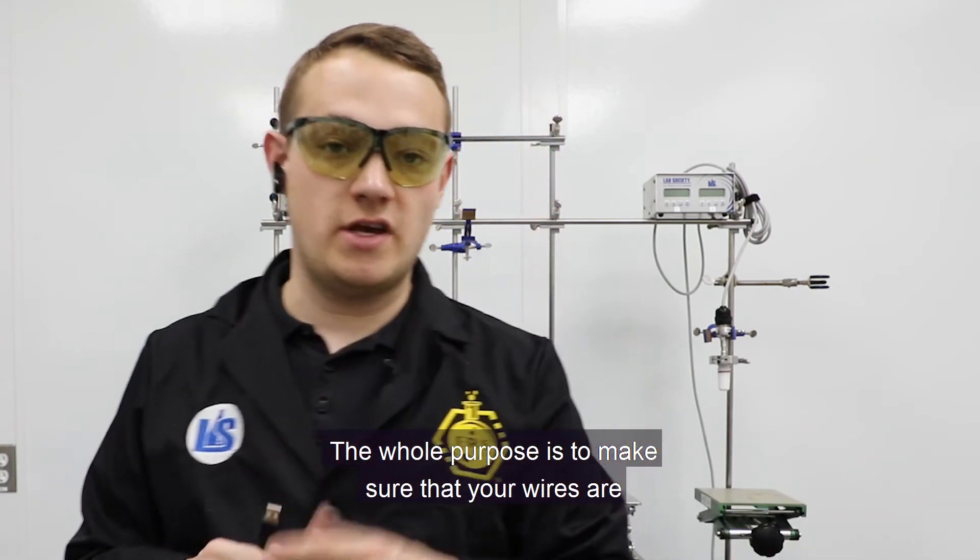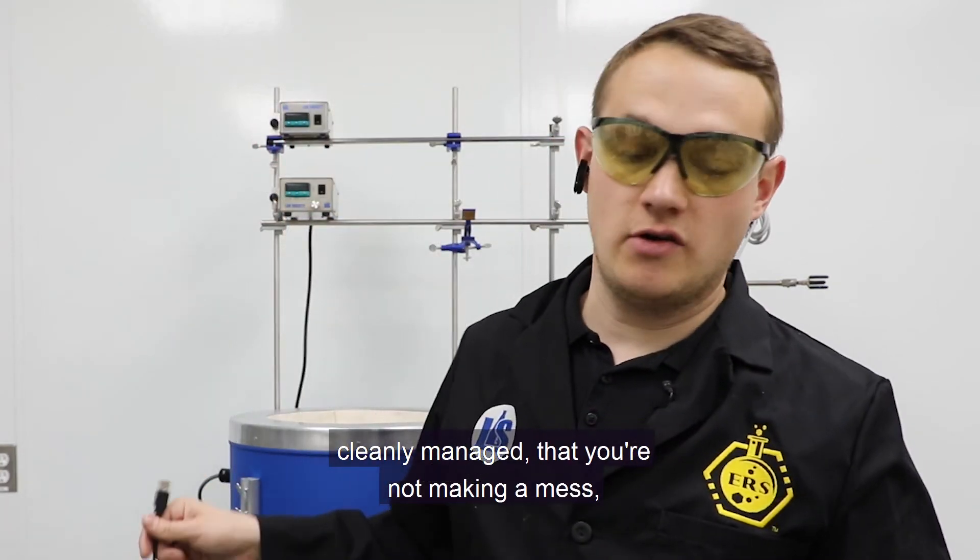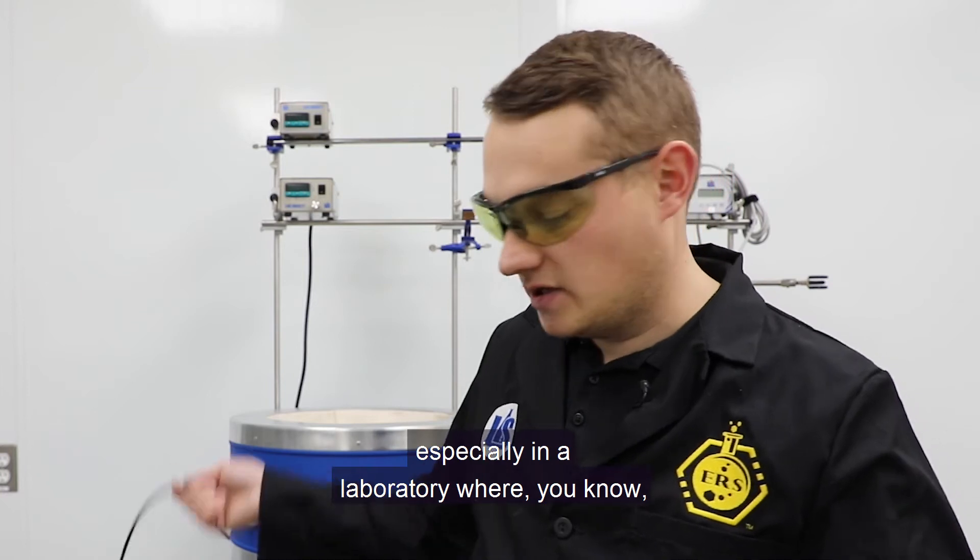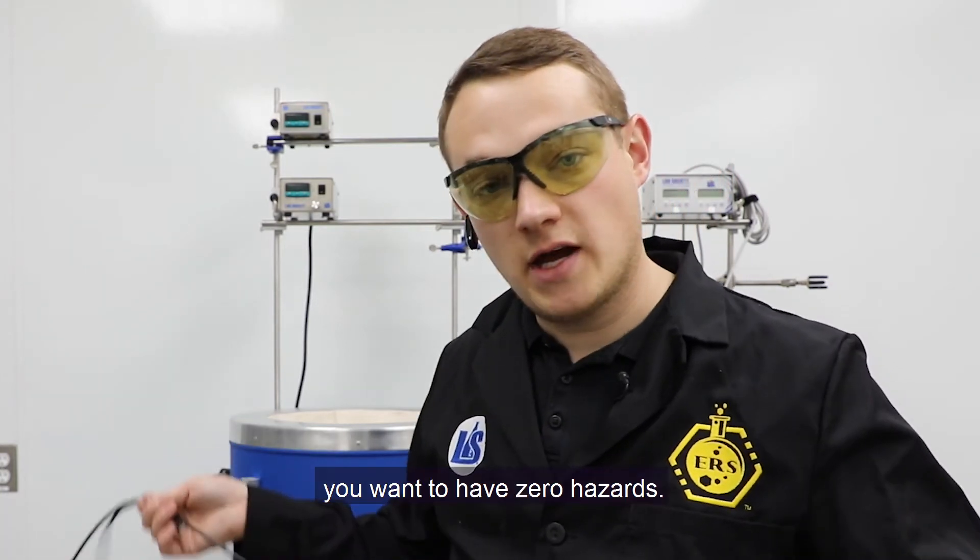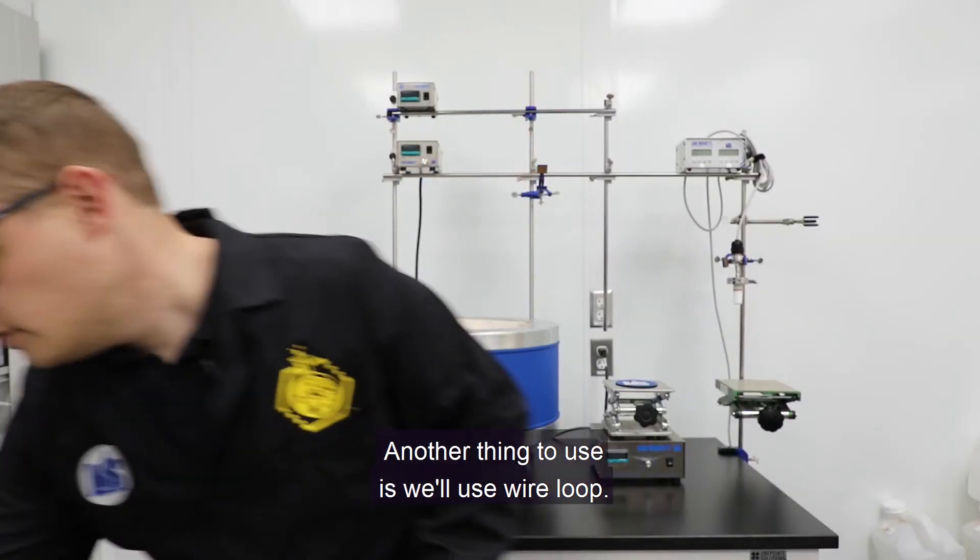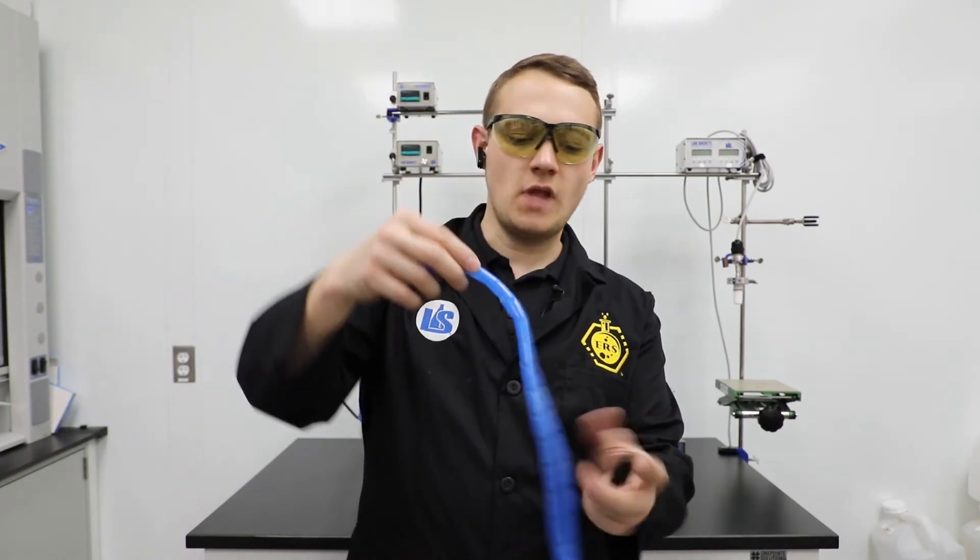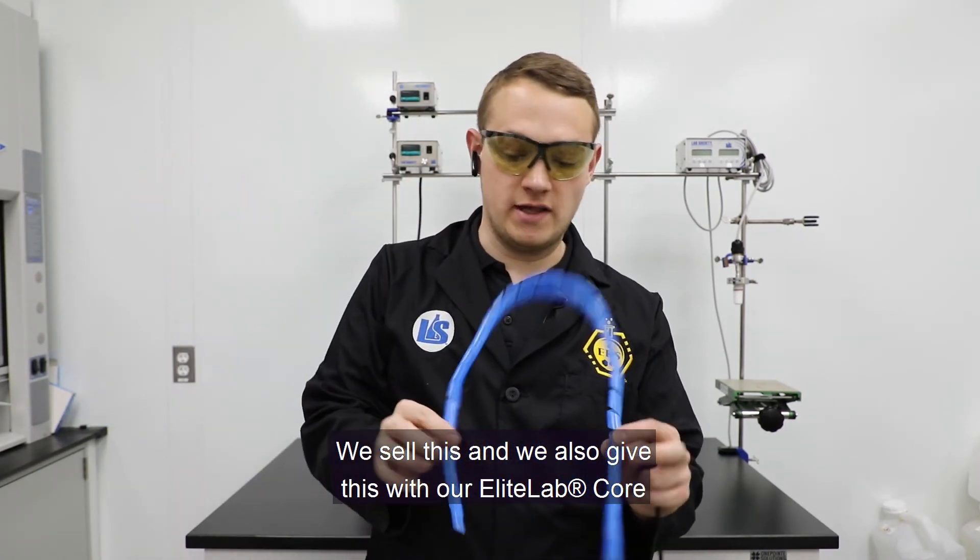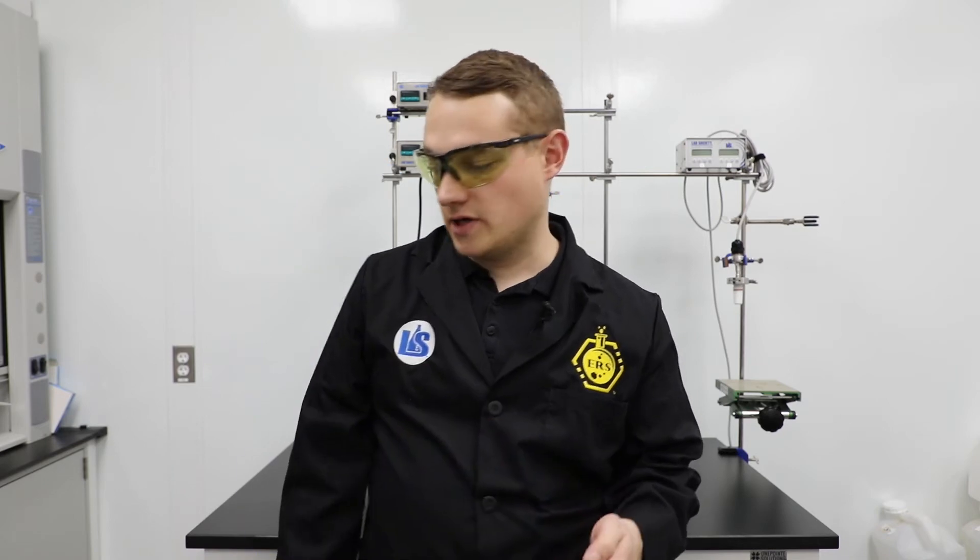Our whole purpose is just to make sure that your wires are cleanly managed so that you're not making a mess, especially in a laboratory where you want to have zero hazards. The other thing we use is wire loom. We sell this and we also get this with our Elite Lab core kits to kind of wrap up and manage your wires a bit.